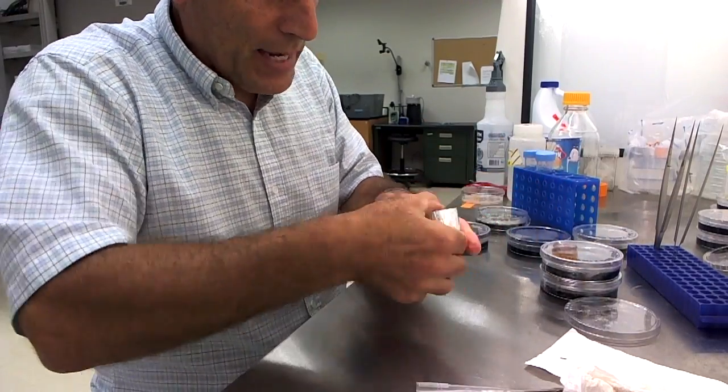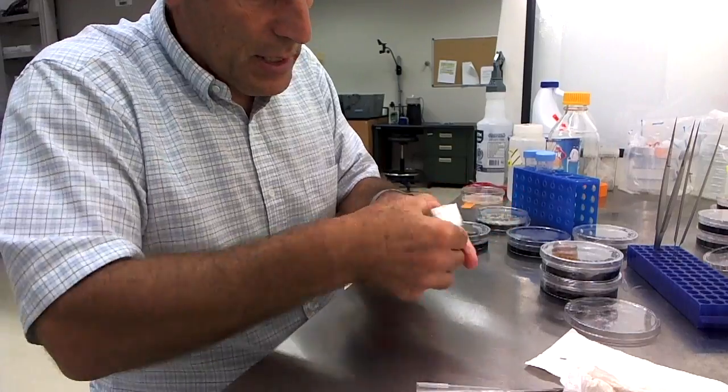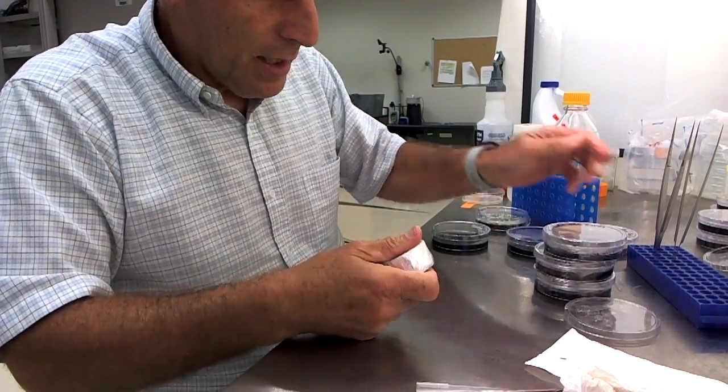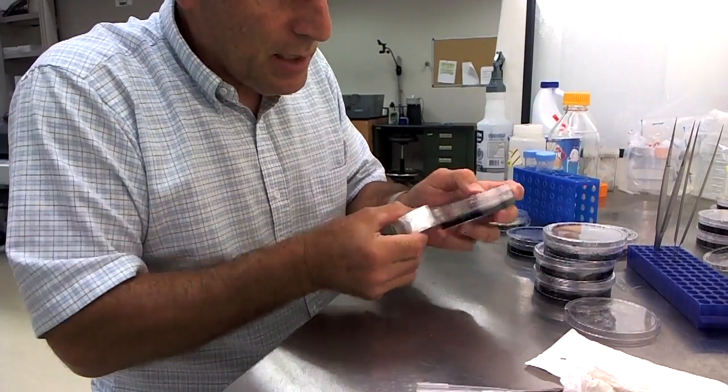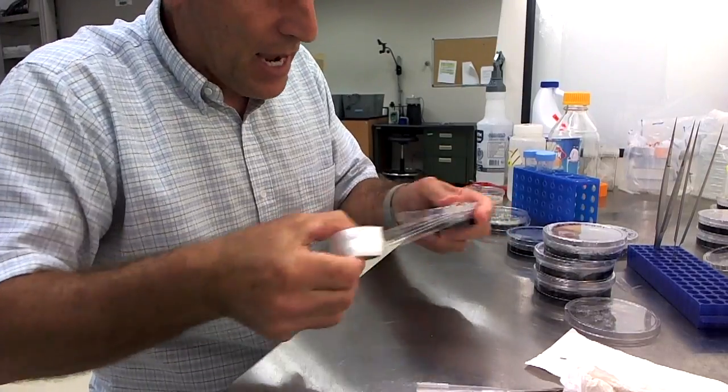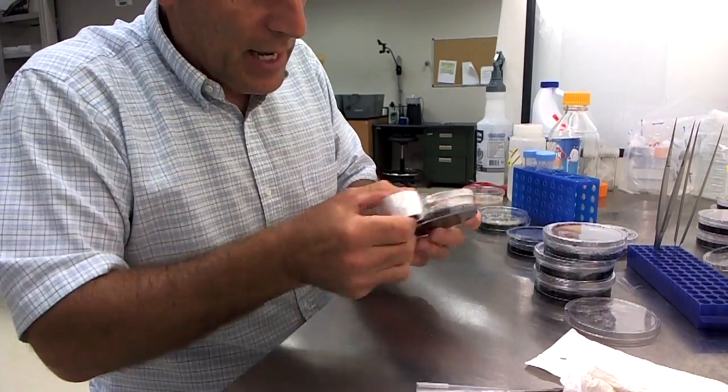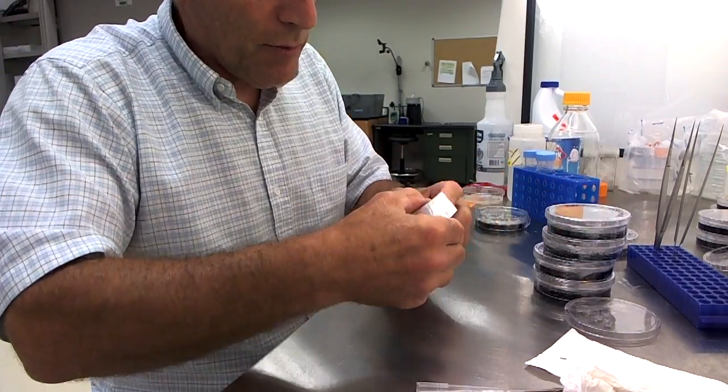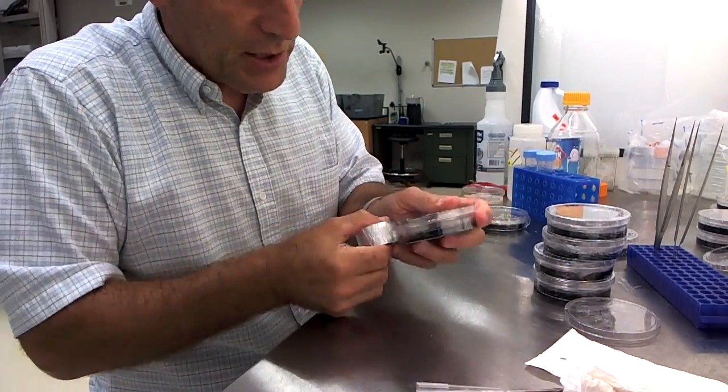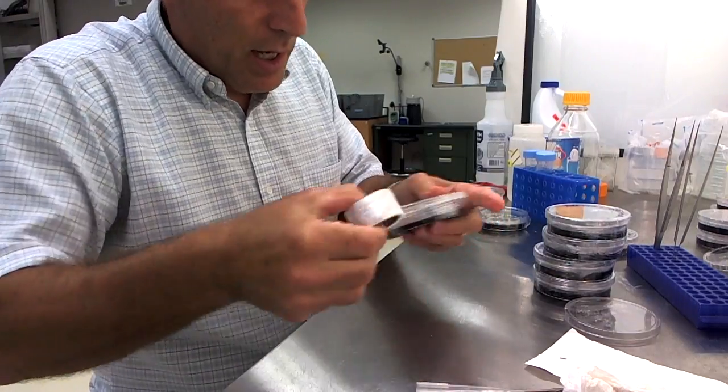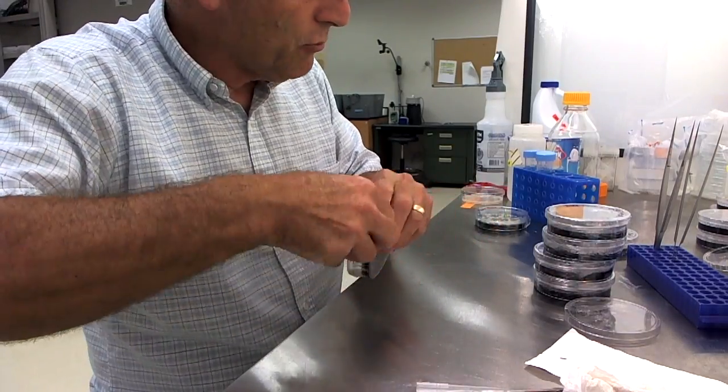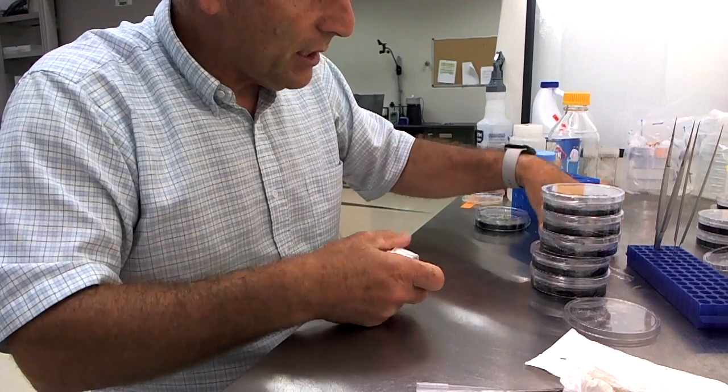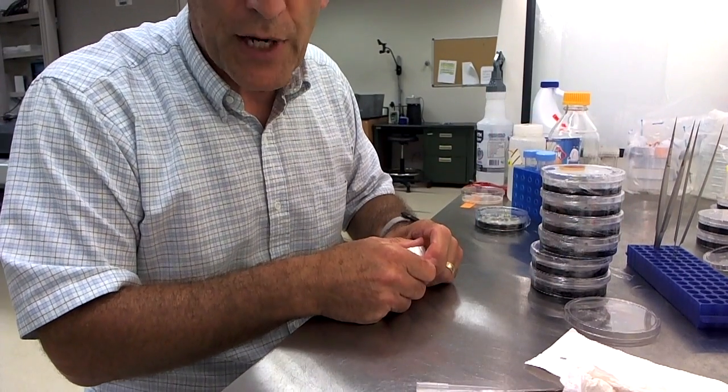That's it for the seed plating from the capsules. The next step is to now move on to the seed sterilization of the seed that's already been removed from the capsules. That's a little different and a little bit more challenging.